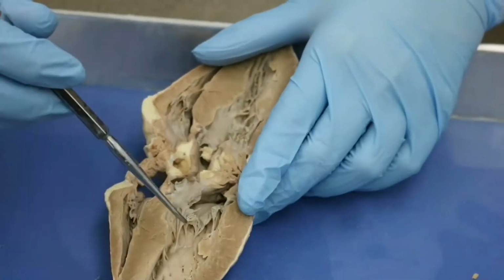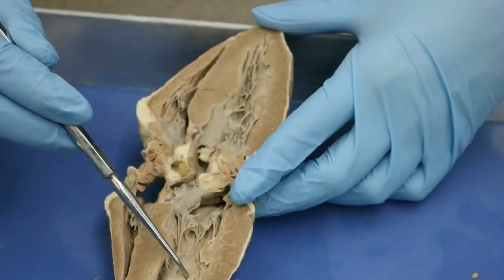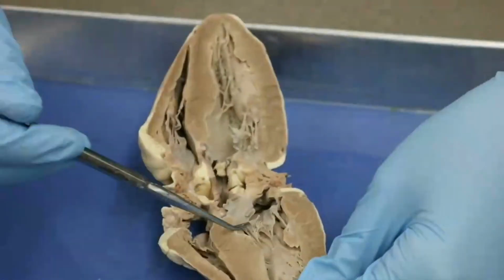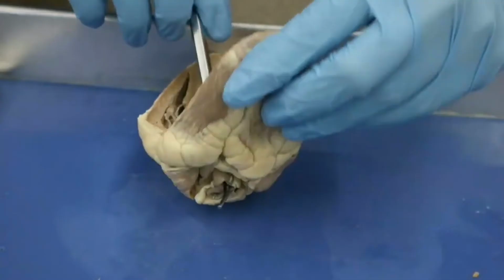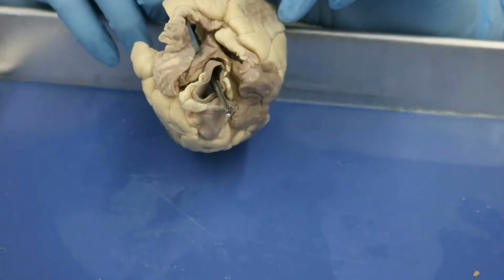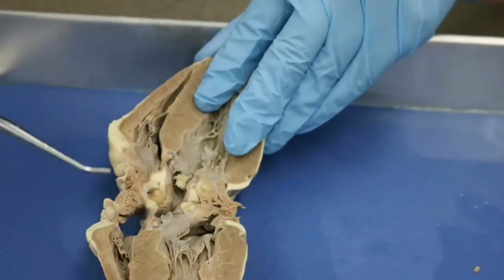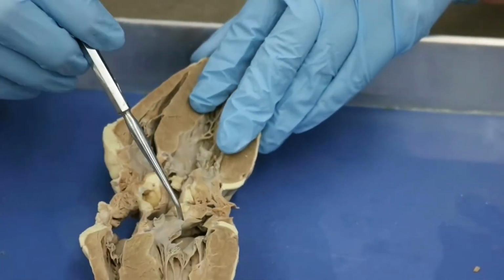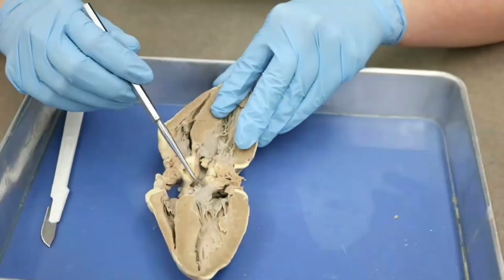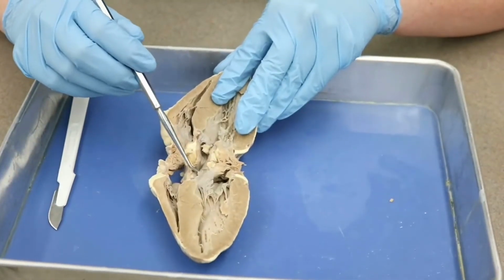Now, similarly, we would go from the left ventricle into the aorta. So let's see. If we follow this, we end up coming out through what we had identified as the aorta previously. So that makes this hole here the aorta, and that means that some of this tissue here is probably the aortic valve, okay? Some of this stuff here is probably aortic valve, all right?